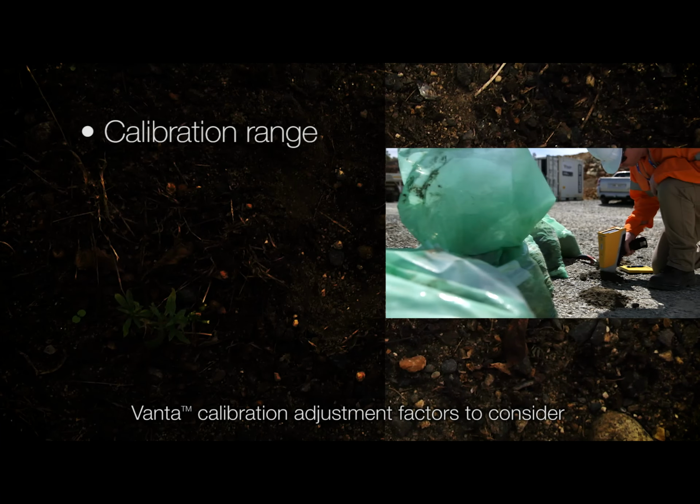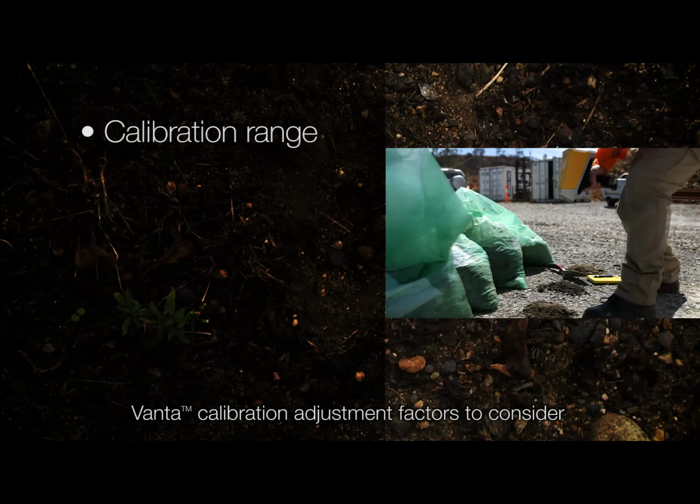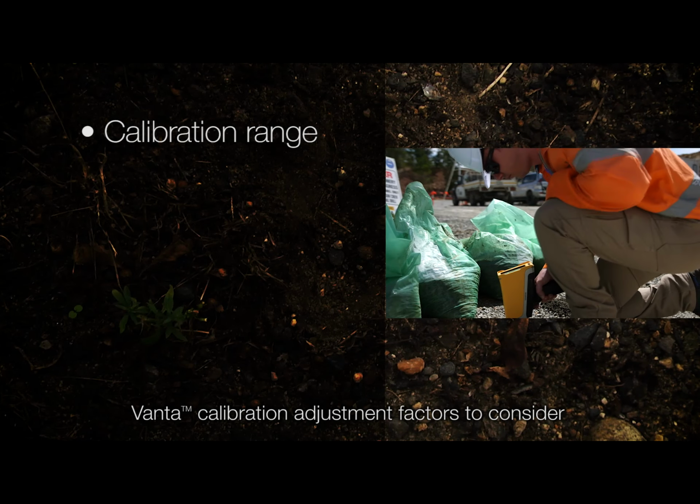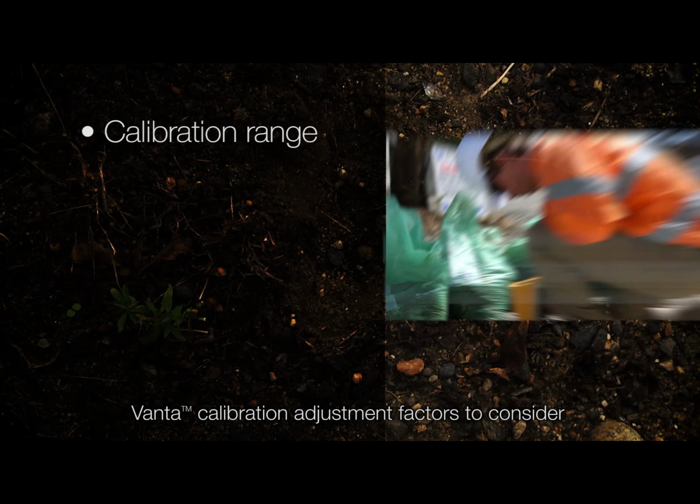There's several other factors to consider when adjusting the factory calibration on board your VANTA analyzer. Here's our list of the most important. Calibration range. When you calibrate the analyzer, you need to calibrate it for all the concentrations you are likely to encounter and as many as evenly spaced points in between.